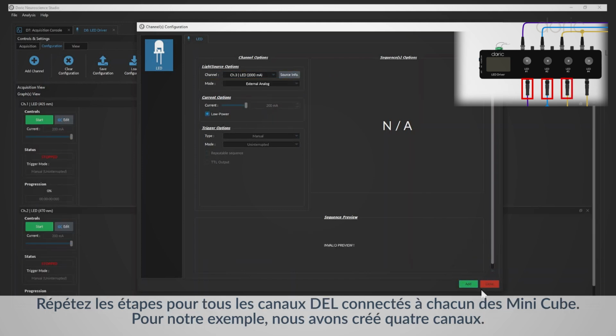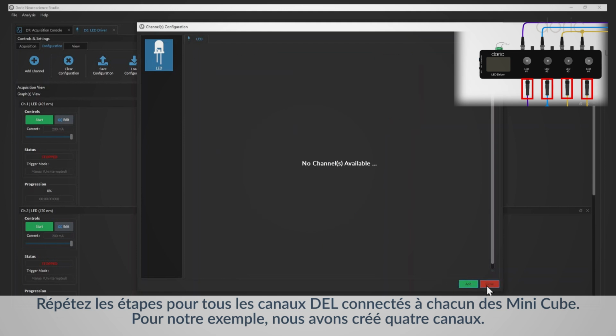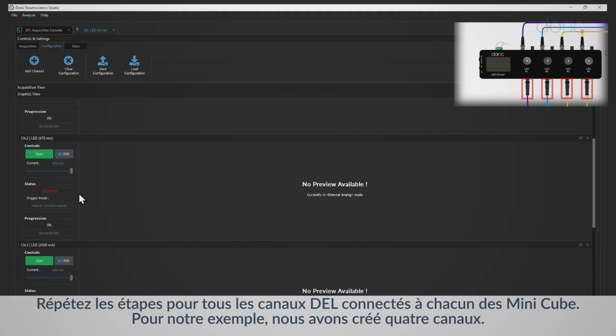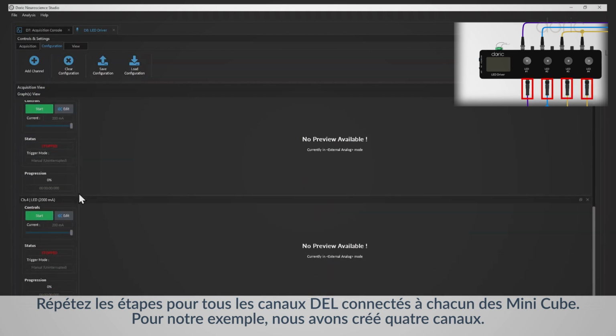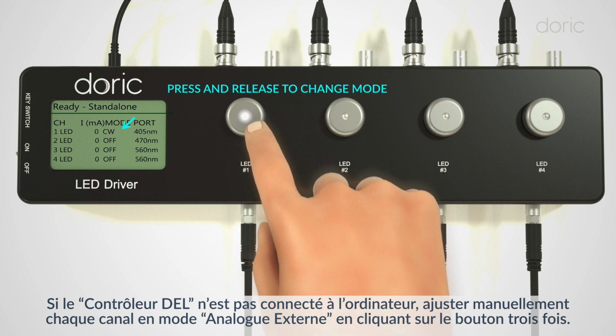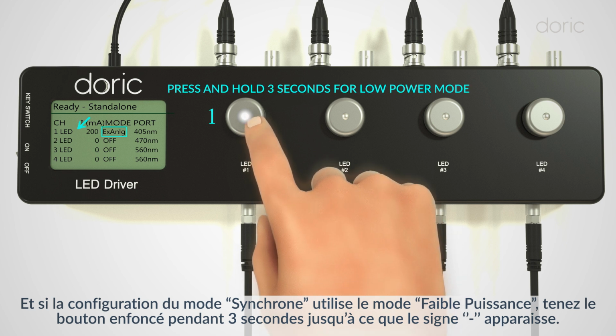Repeat this step for all of the LED channels connected to each minicube. For our example, we have created 4 channels. If the LED driver isn't connected to the computer, manually set each channel to external analog mode by clicking the knob 3 times. And if the lock-in configuration uses the low power mode, hold down the button for 3 seconds until the minus sign appears on the screen.